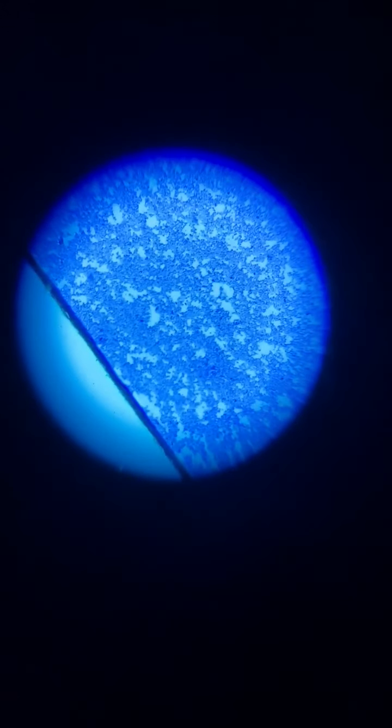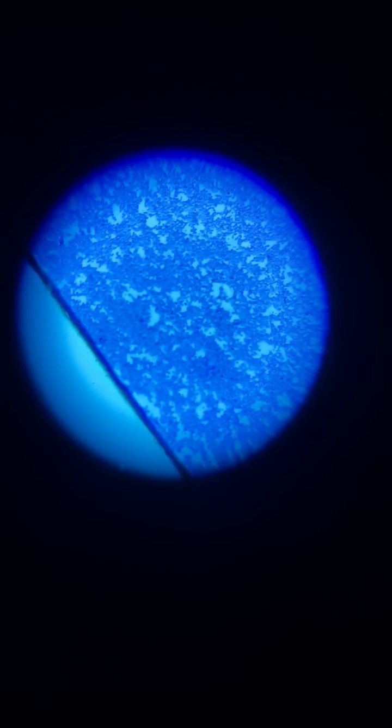This is human blood. Let's put this in here. Put it back to 4 times bigger, and see.